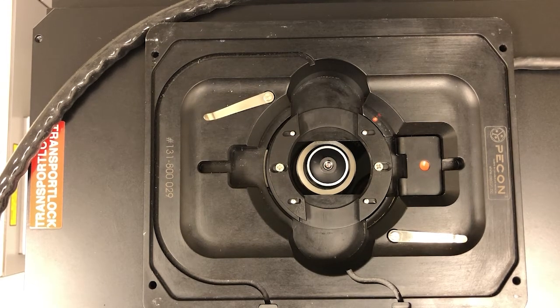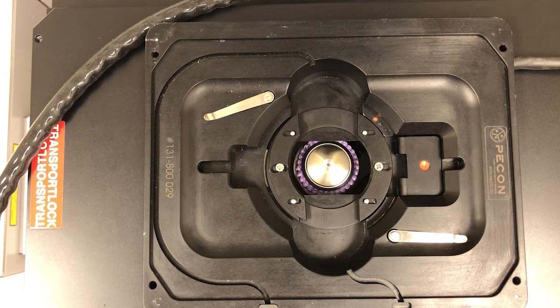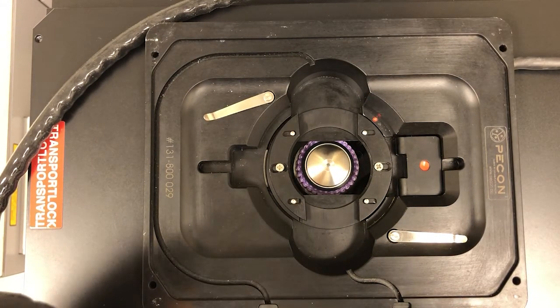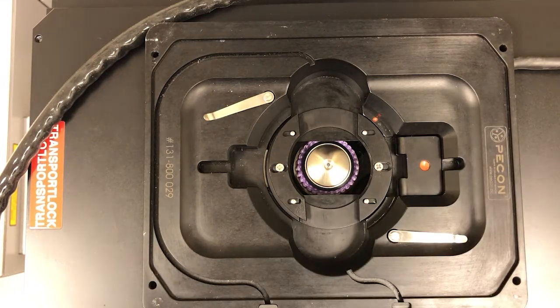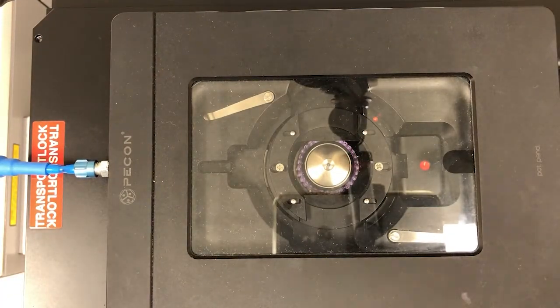That's actually what I need to do now. So I will let the 10x go up, move to the 40x oil, oil this, and go get my sample to place it on the system. So I'm gonna go do that, and then I'll restart the video.